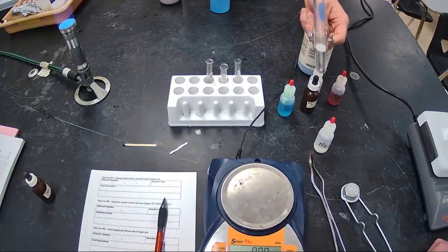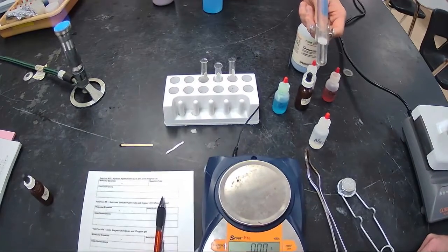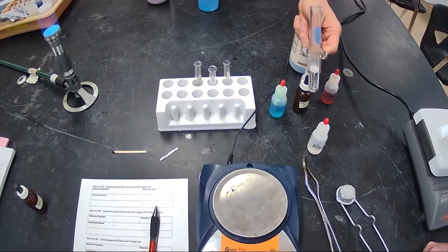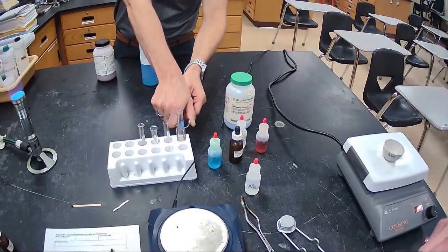Once that magnesium ribbon is all used up, or the amount of hydrogen in the hydrochloric acid is used up, then it will stop. That's a limiting reactants type of question that we will get to later on in this school year. All right, so let's go ahead and get our, we're at 5 minutes.